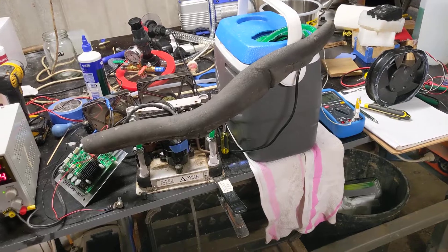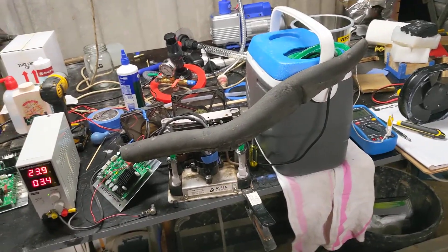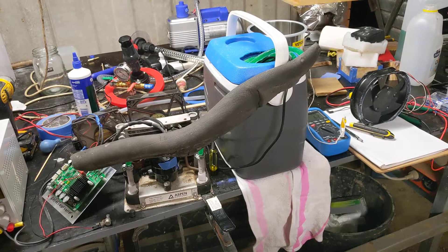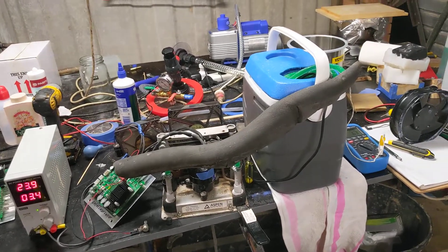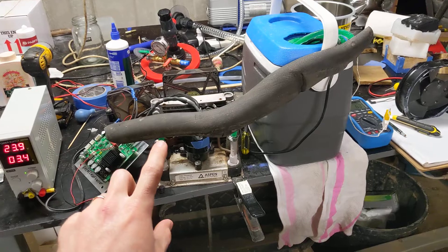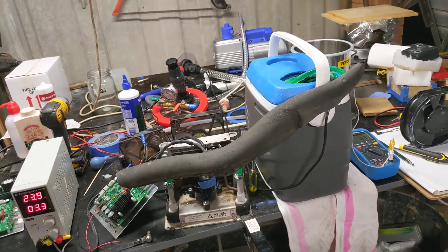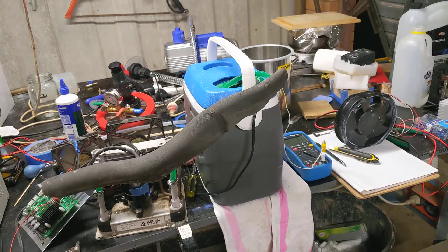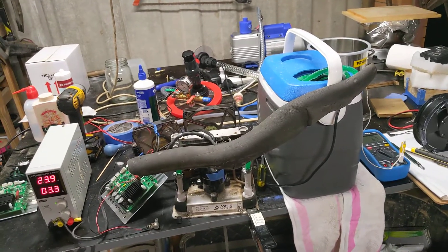I think it's going to take a very long time to get down to negative 30, and once it's there I'm not quite sure how much heat flux it's going to be able to handle at that temperature. If the amount of heat it can take out of the liquid reduces as the temperature gets colder, and it has to handle 100 watts at negative 30 and can't keep up, then this just isn't suitable for that application. I do have one of these that's two in series, which would double the cooling power. But I don't know if I want to wait three or four hours to get it down to cold trap temperatures. I'll leave this running and see how low it gets.